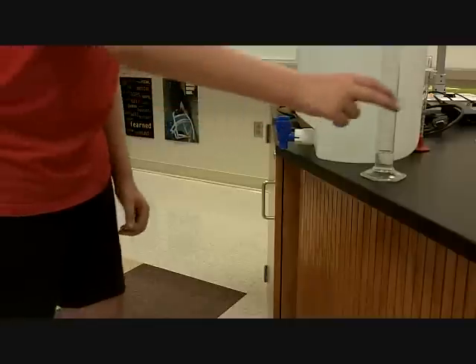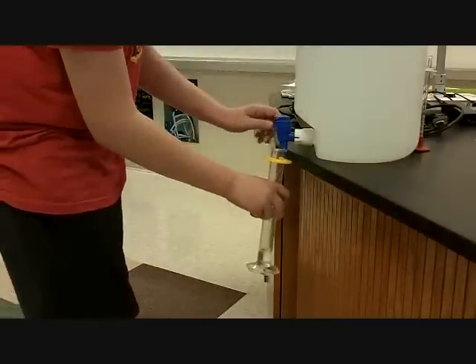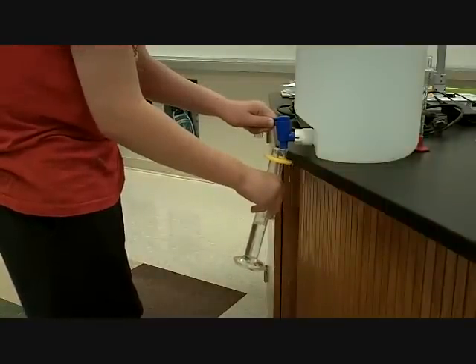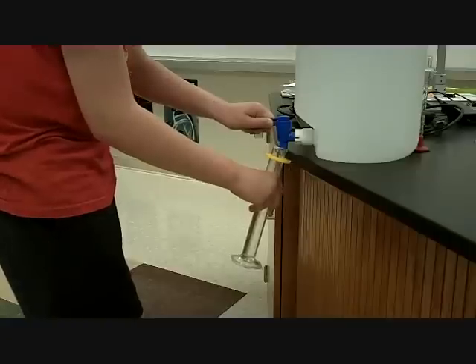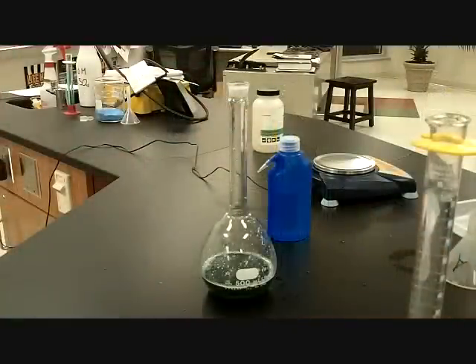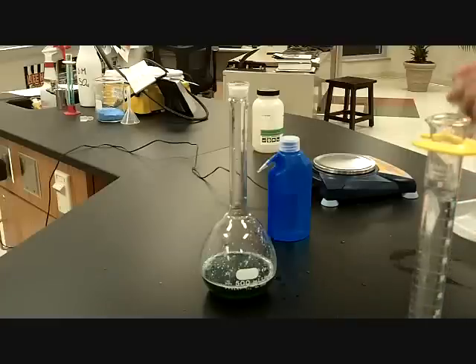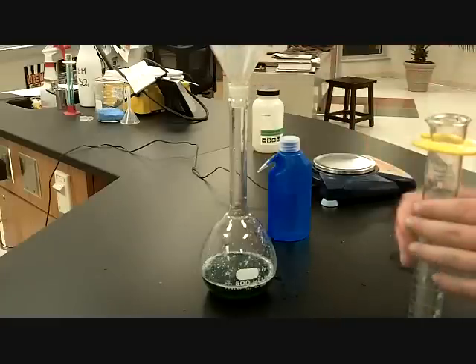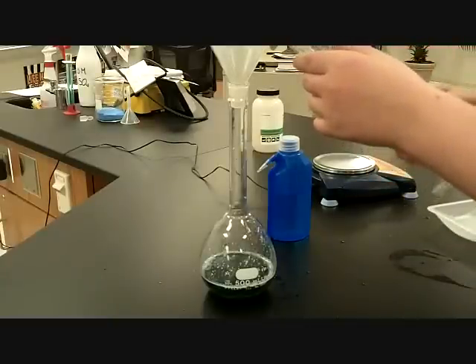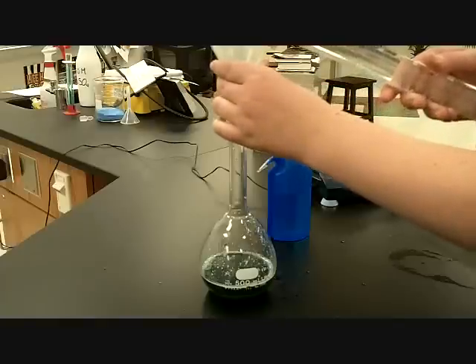Samuel, why don't you go ahead and get about 90 milliliters of water. Get it inside the flask or in the graduated cylinder. Shut it off. Okay. Good. Okay. All right, Samuel, go ahead and add that water to the volumetric flask. Now, you may need to use a funnel to do this. So, I don't think we have enough in there, so it's okay if you add all of that.